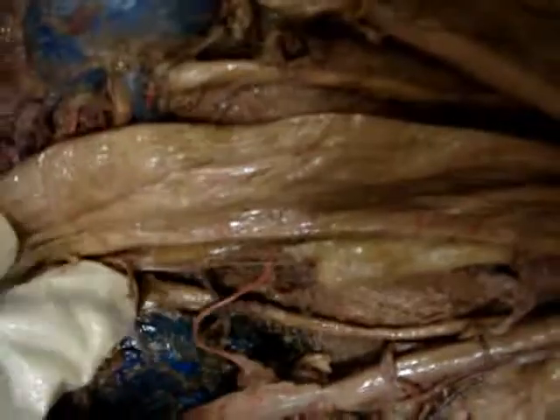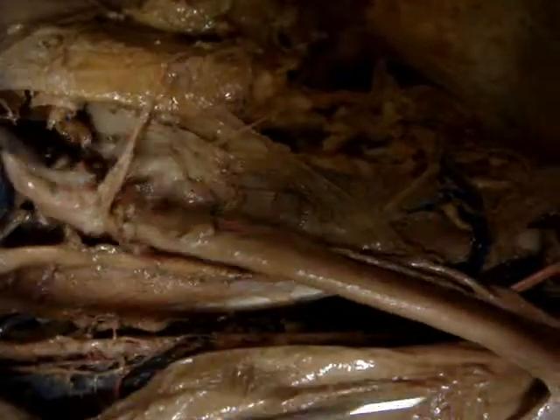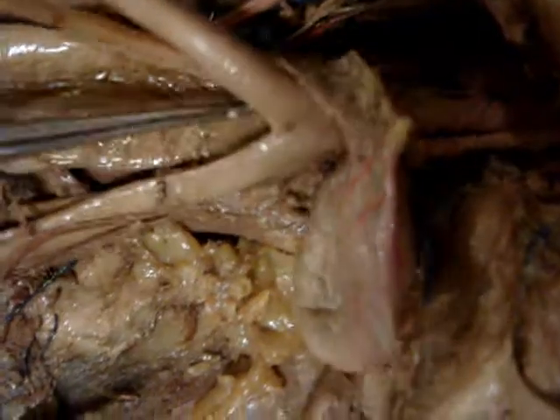Can we start with the ovarian thing? So this is the ovarian artery — ovarian artery attached to the ovaries. And there's the ovary right there. And then this is the uterine horn, here and here. That attaches to the body.